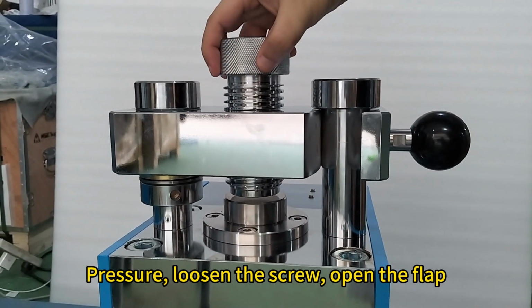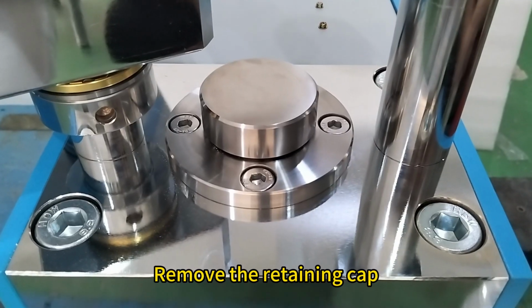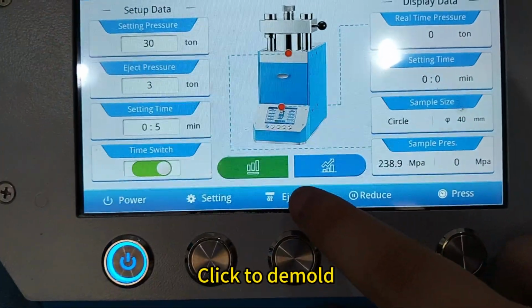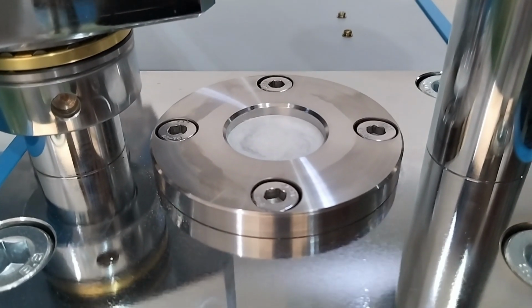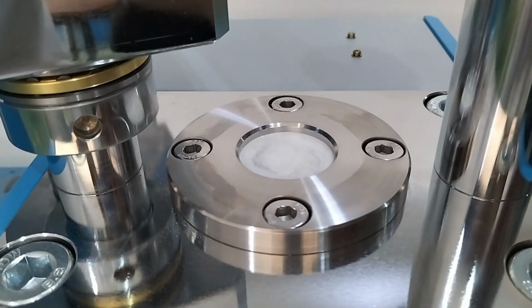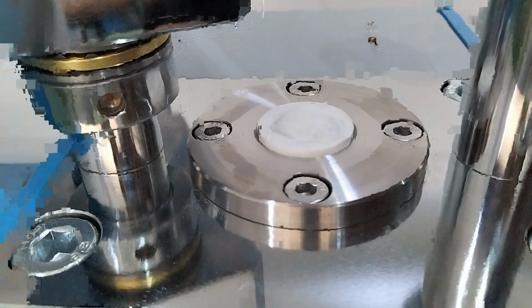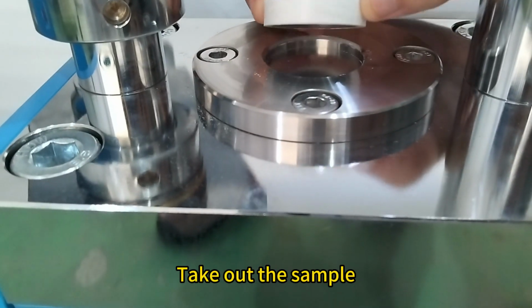Pressure, loosen the screw, open the flap. Remove the retaining cap. Click to demold. Take out the sample.